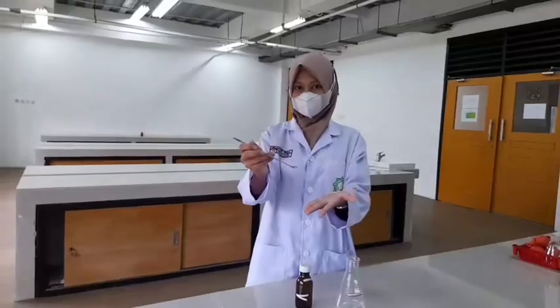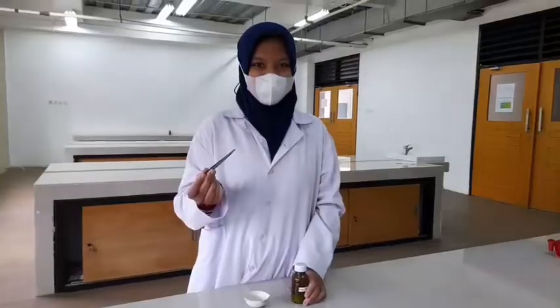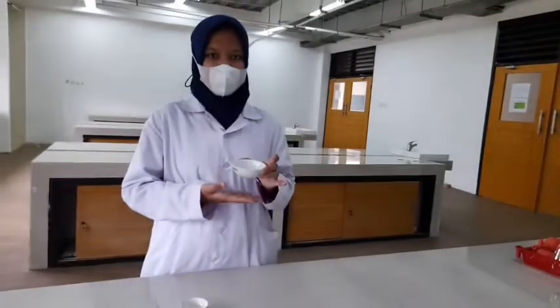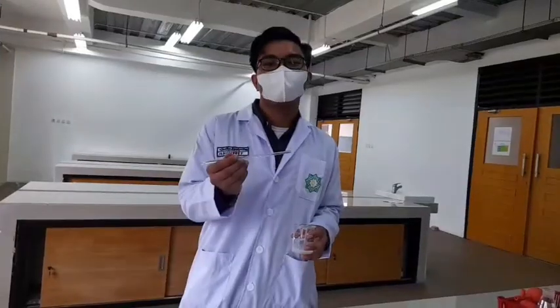Spatula, used for moving small amounts of solid from place to place. Forceps, for picking up or moving very small items in the lab. Evaporating dish, used to recover dissolved solid by evaporation. Glass rod is used to stir liquids, usually made of glass.